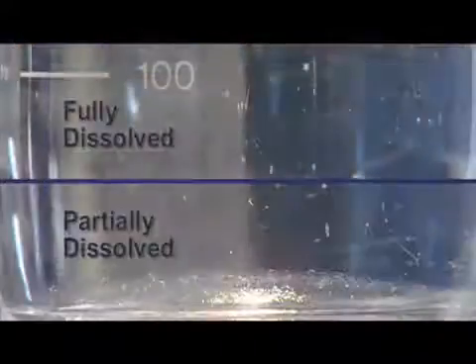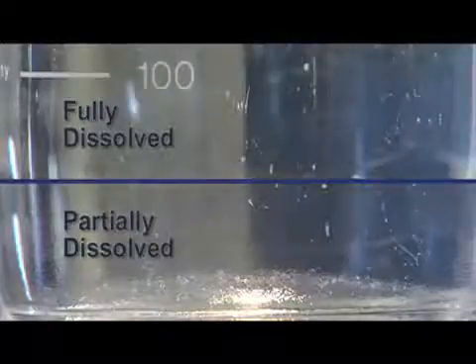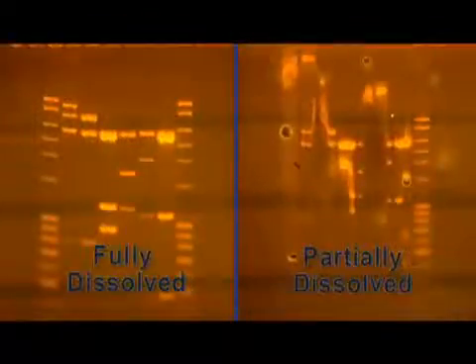The agarose is only fully dissolved when it's completely clear. If you don't completely dissolve the agarose, your finished gel will have regions of different concentrations, and your nucleic acid samples will not separate correctly.